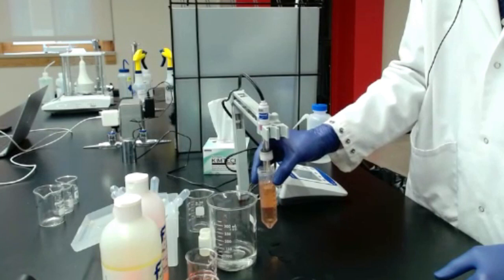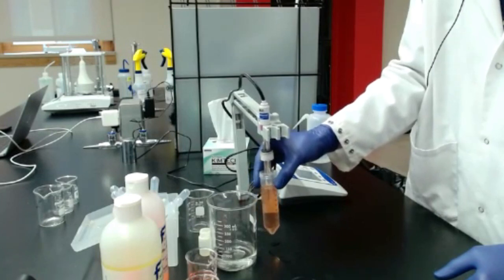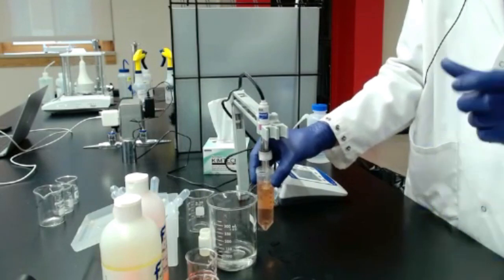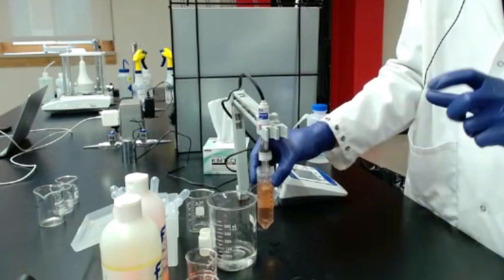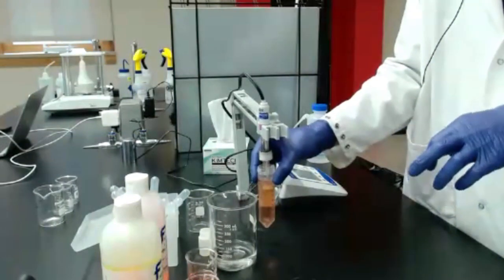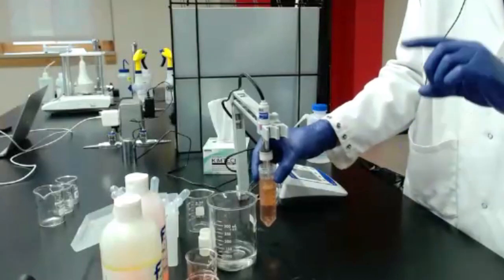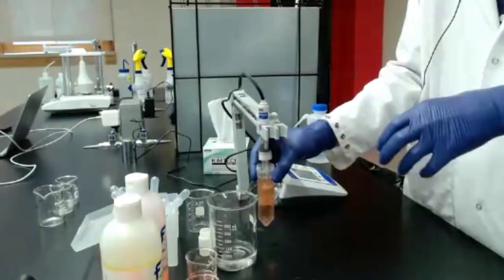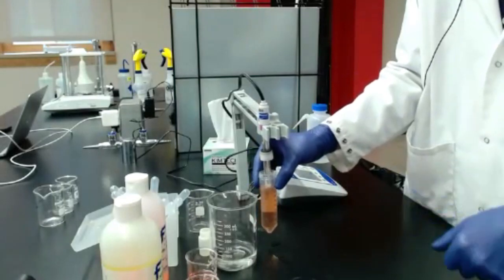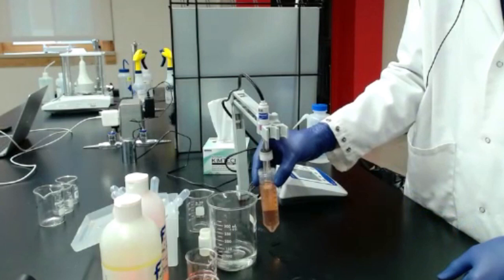So if you're just starting to get the juice going, sometimes on different pH meters, it won't automatically switch between the calibrate and the measurement setting. So if you went to calibrate and it's giving you a little bit of trouble with the sample, make sure you hit the measure setting or whatever, so it'll go back to a live measurement. Not always clear on each model.